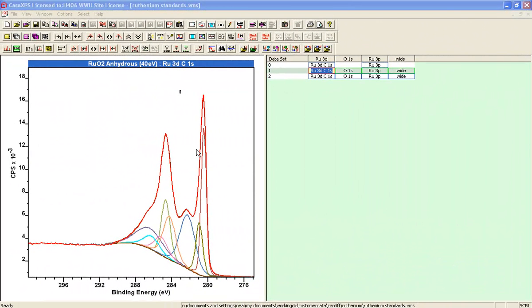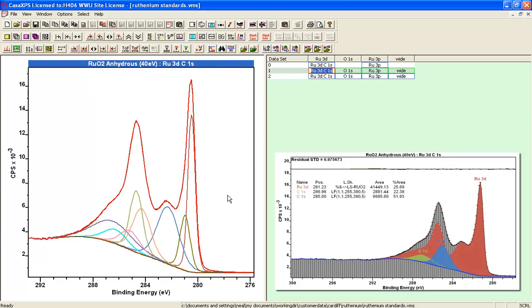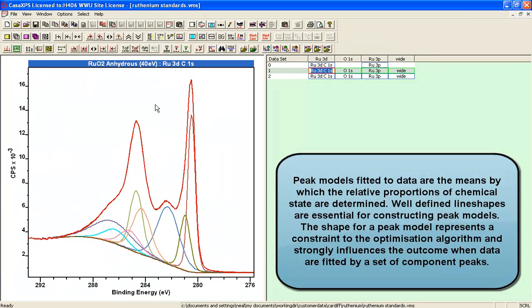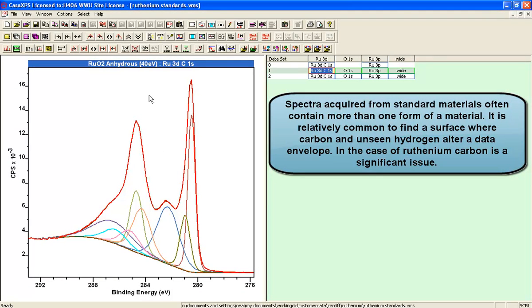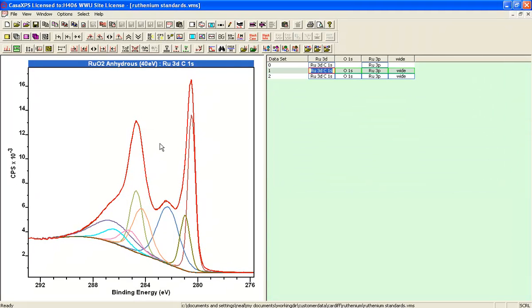These data were acquired from a standard material, which is ruthenium oxide in the 4+ state. The idea of acquiring these data is to produce a line shape from data that can be used in other peak models. However, in this case you have the potential for carbon 1s to appear at the same place as the ruthenium 3D, so what we need to do is find a way of removing the carbon 1s signal from ruthenium so that we then end up with a line shape that does not depend on the level of contamination of the material.